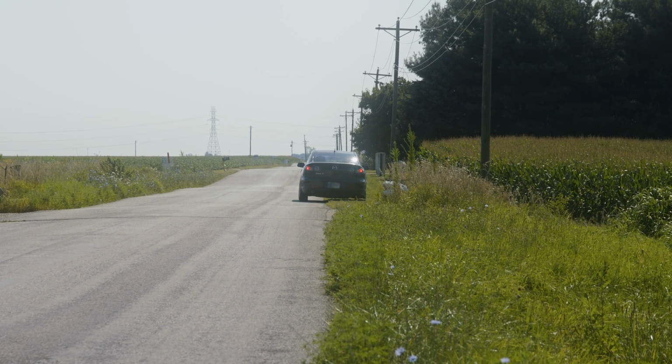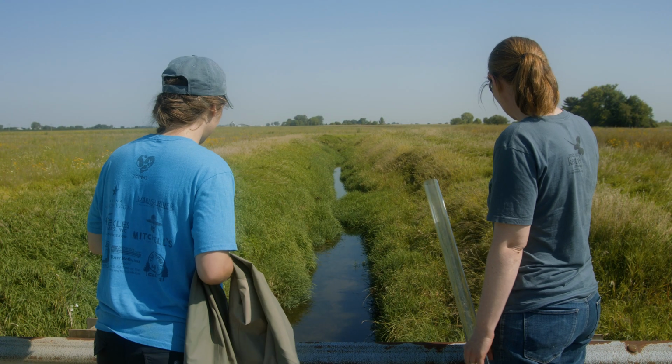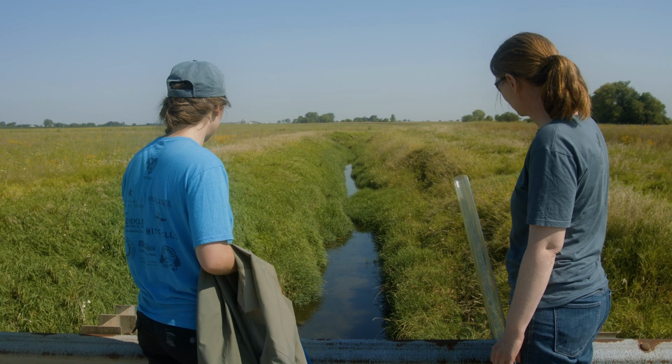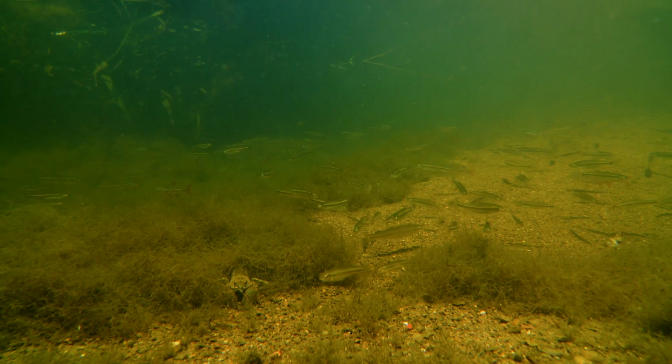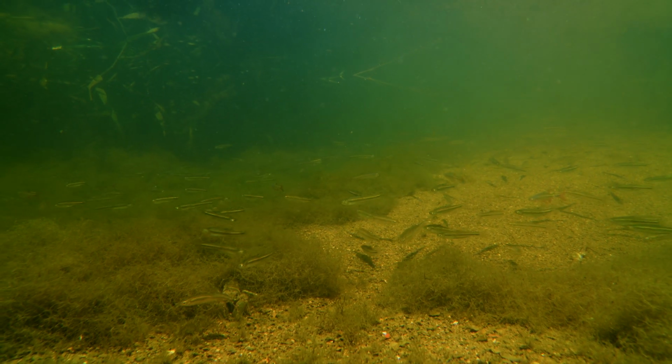Once at your sampling site, get out your supplies and look at the site conditions to determine a good place to enter the stream and sample. Try to sample from the deepest and fastest moving part of the stream that you can, but avoid debris and surface films. The deepest part of the stream may not always be in the middle.